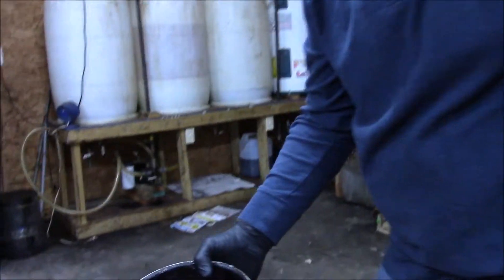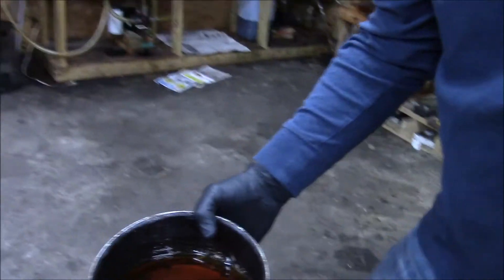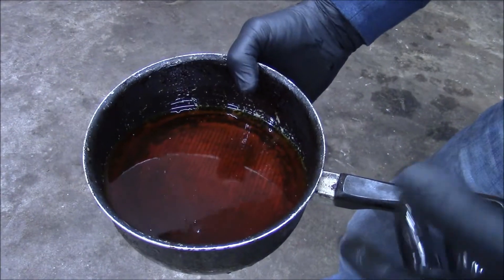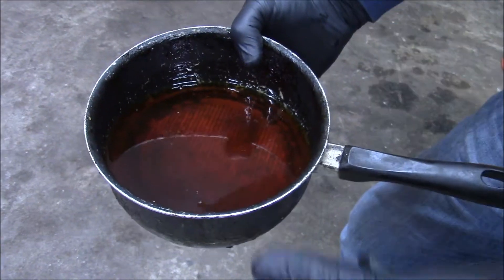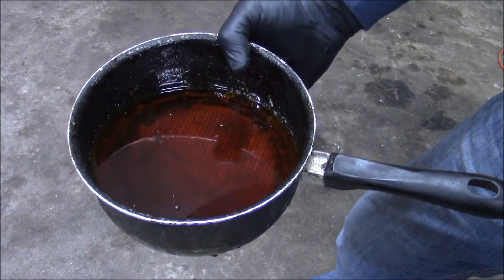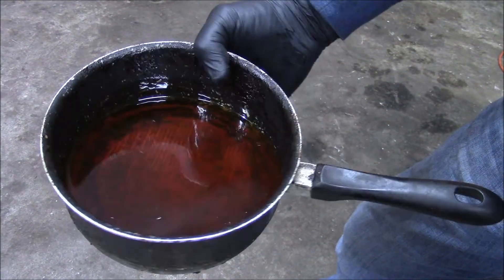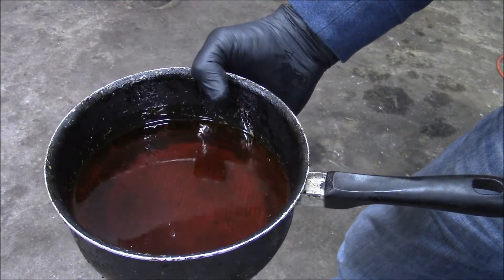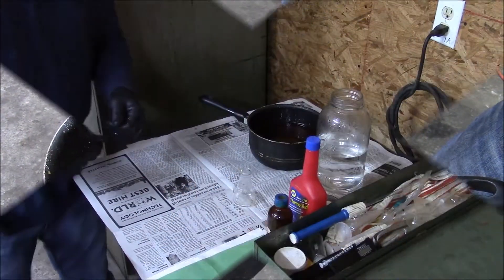I've got about a quart in there. If there was anything in the line, I made sure I got that through and then I got some new material in there. So this should be representative of our entire sample.